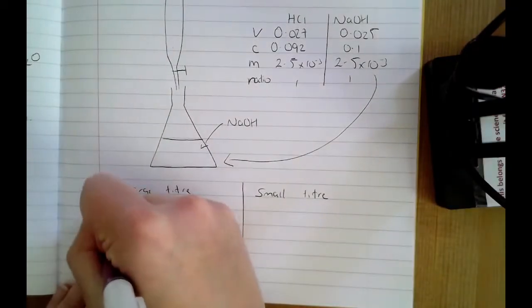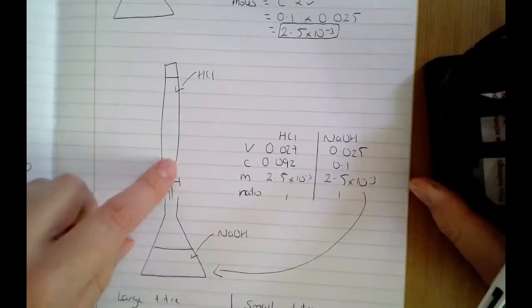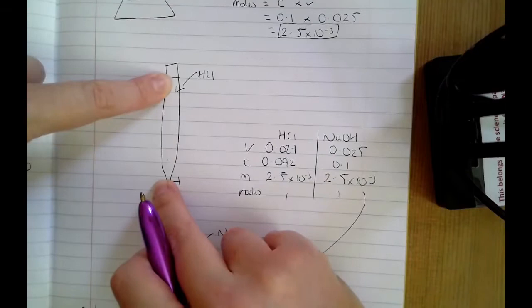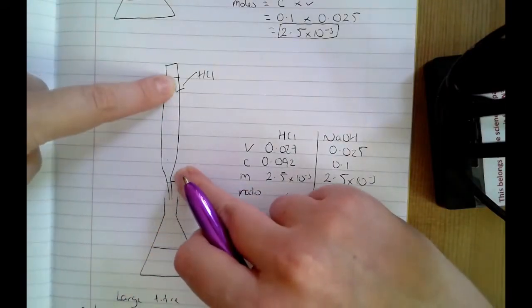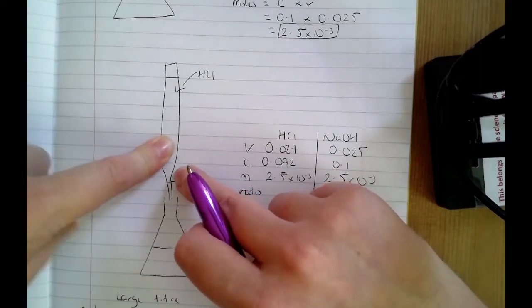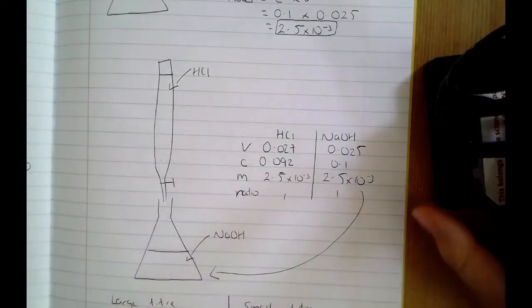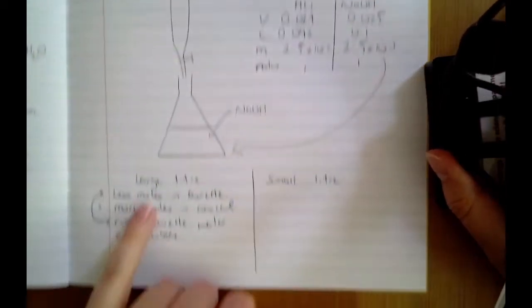Another thing that you could have in there would be an air bubble. When you're filling the burette, if you end up with a big air bubble, then again, you're getting less volume into the burette than you're supposed to. And when you open the tap and say you think you've added 20 centimetres cubed, you haven't actually added 20 because a part of that volume had a big air bubble in it. So you're adding less than what you're expecting. Both of those will give you a larger titre than you're expecting.